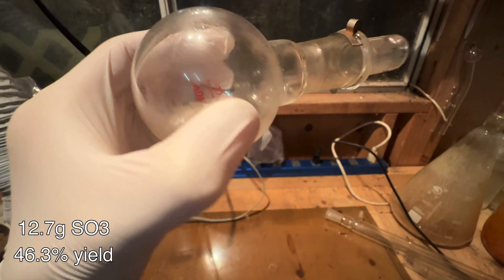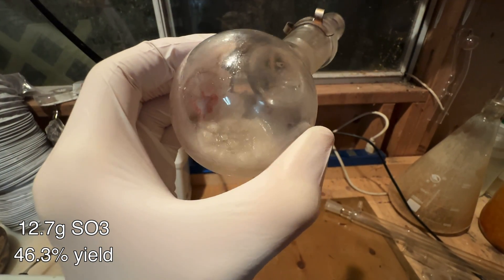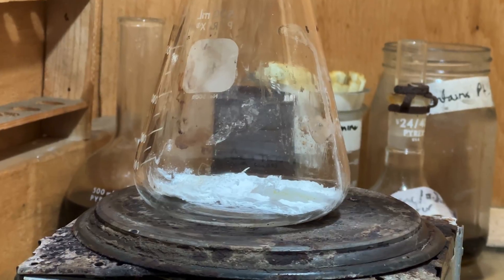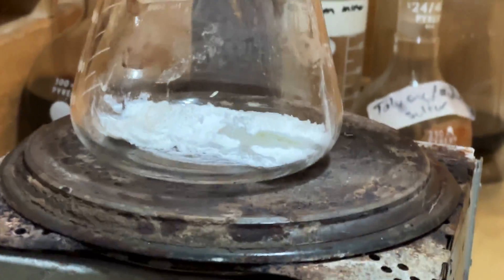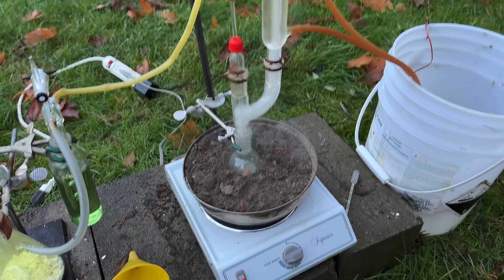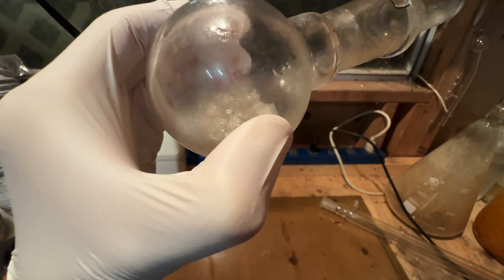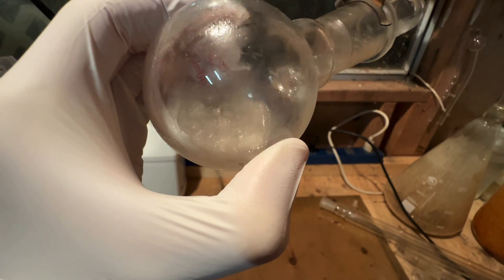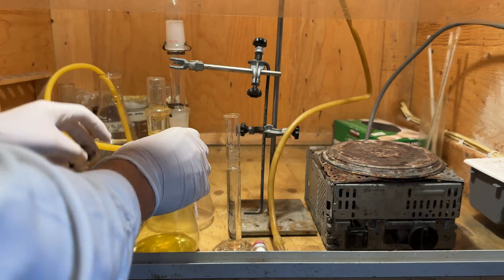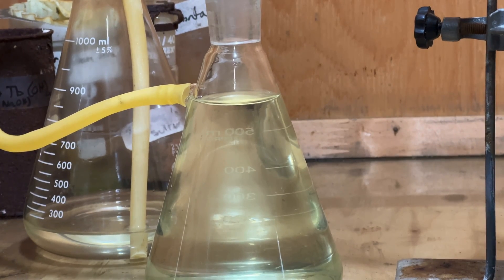In the end, 12.7 grams of sulfur trioxide was obtained, corresponding to a 46.3% yield based on the starting tin(IV) chloride. Theoretically, the tin(IV) oxide remaining in the flask could be reduced with carbon back to elemental tin, more tin(IV) chloride could be made, and the process could be repeated. Although this method is a great way to produce some sulfur trioxide on a lab scale at relatively low temperatures, tin(IV) chloride is dangerous to handle and produce, and toxic hydrogen chloride is generated.